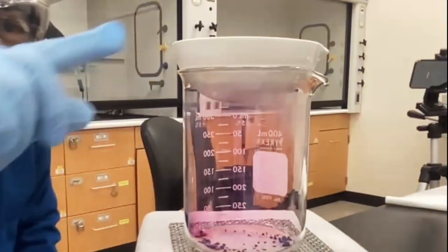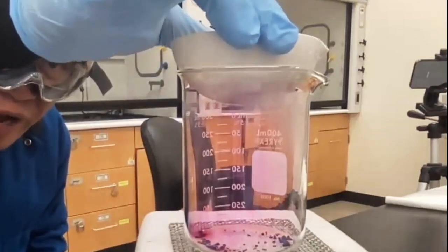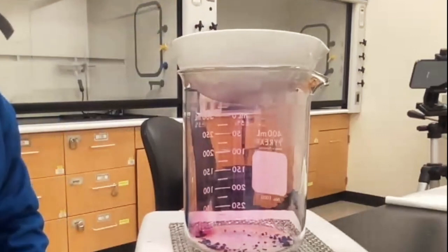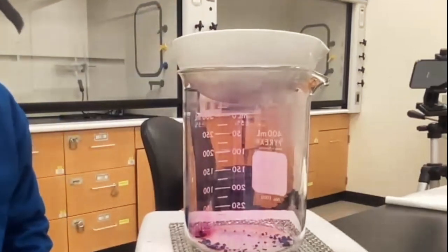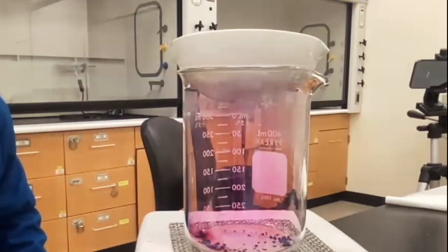And you can see at the very bottom of this evaporating dish, starting to turn brown. And that's because when a gas converts directly to a solid, then that's called deposition, okay? Solid going to a gas is going to be sublimation. Gas going to a solid, that's called deposition.